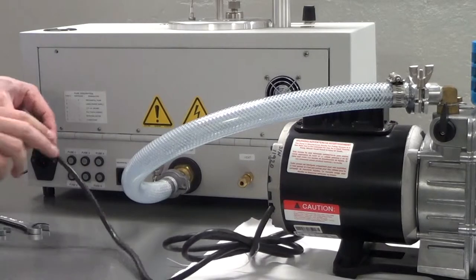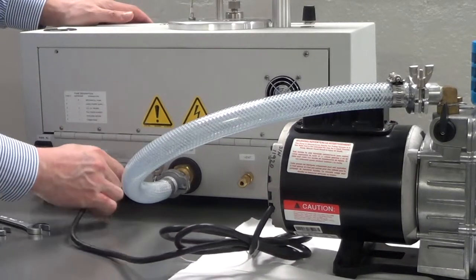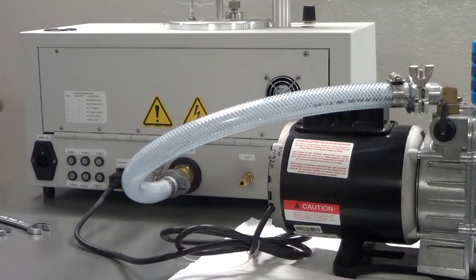Next, connect the electrical cord of the pump. This gets plugged into the back of the unit next to the pump hose you just secured.